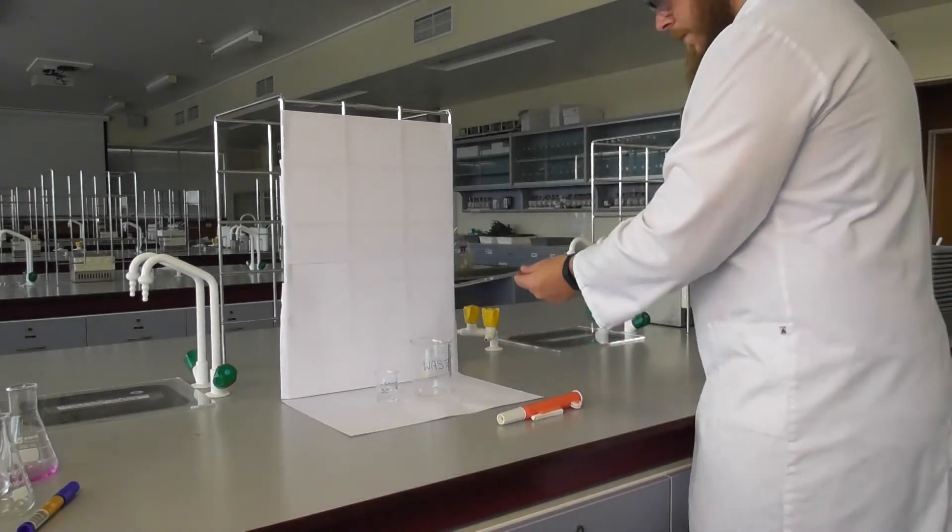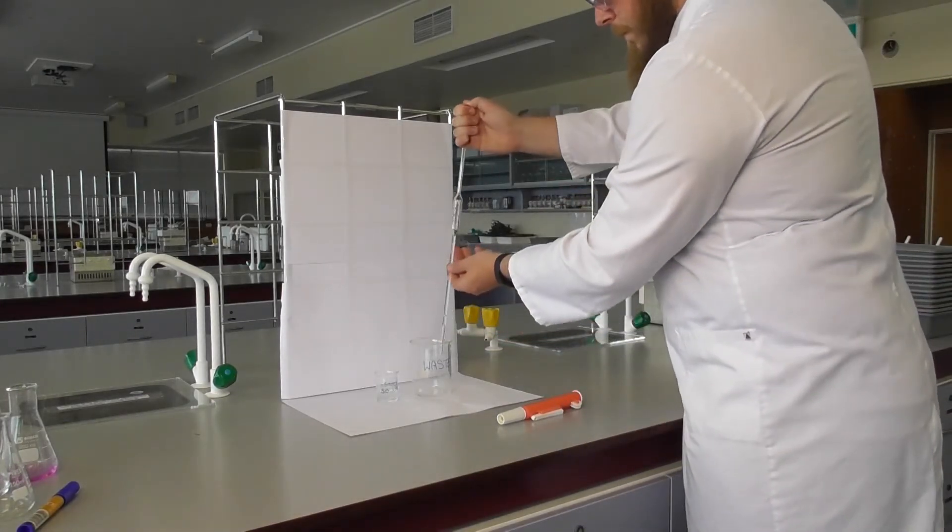Drain this solution into a labeled waste beaker. This process can be repeated if necessary.